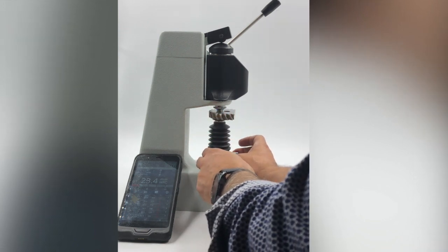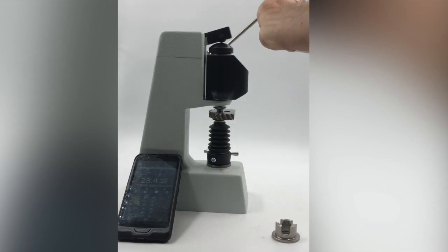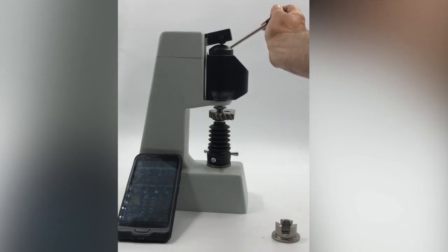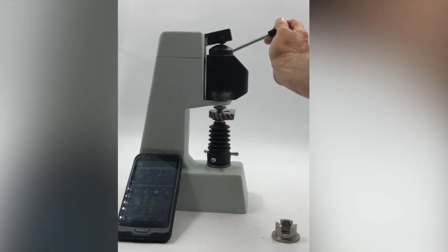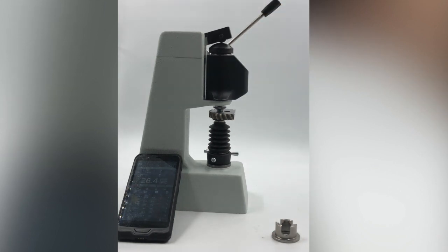Let's tighten it a little bit, and let's start with the measurement. Here we go, here we go.